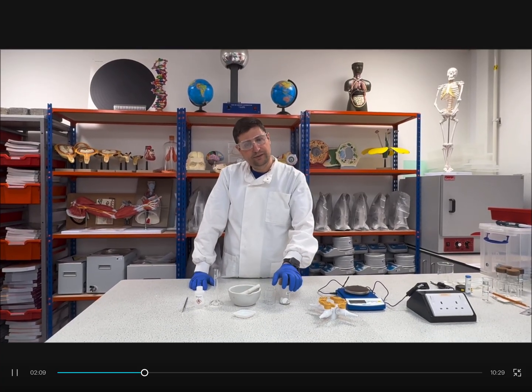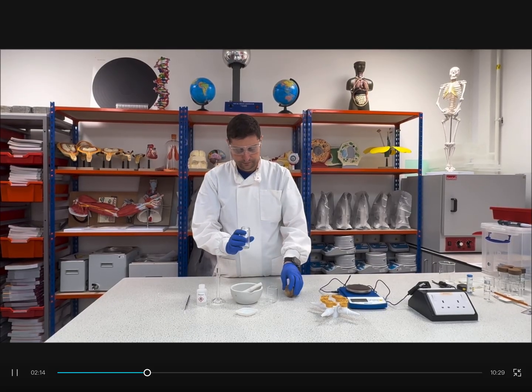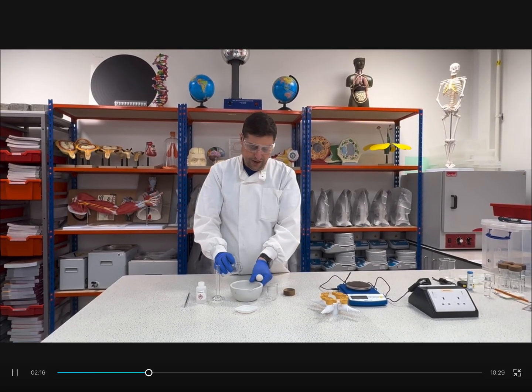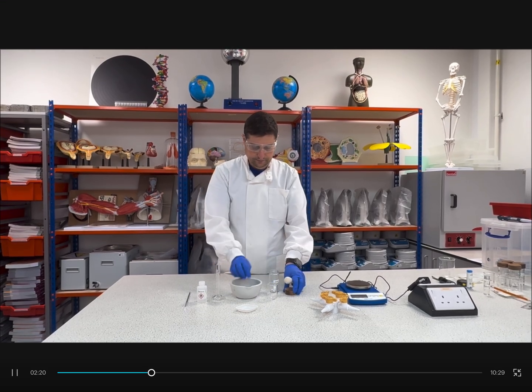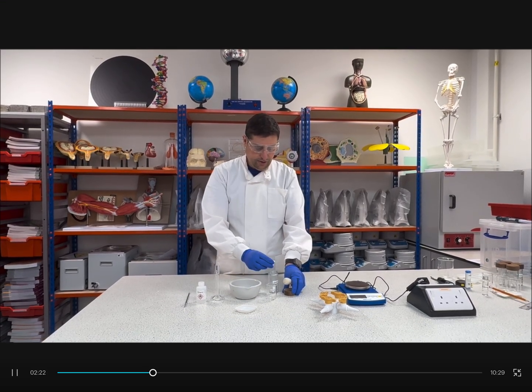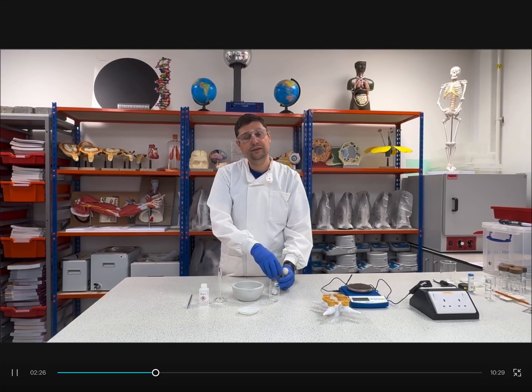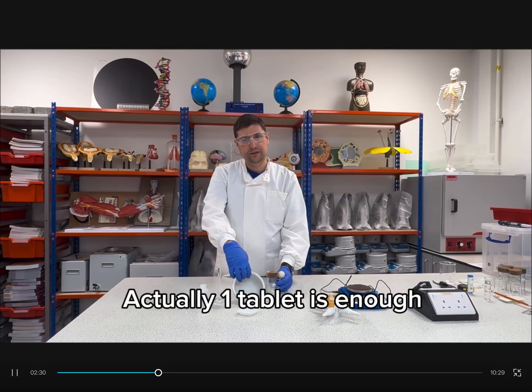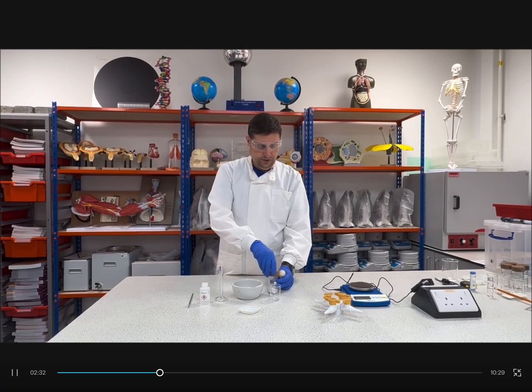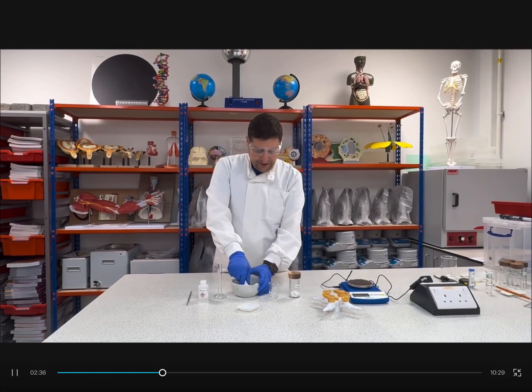Starting with aspirin, I will take my sample and place it in my mortar. Because I don't need a big amount, I just need 0.1 gram. 3 tablets should be okay. So I will grind this as much as I can.